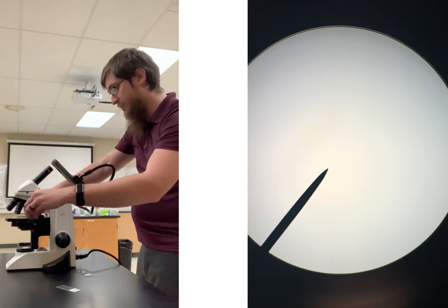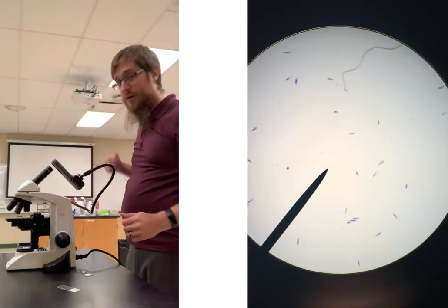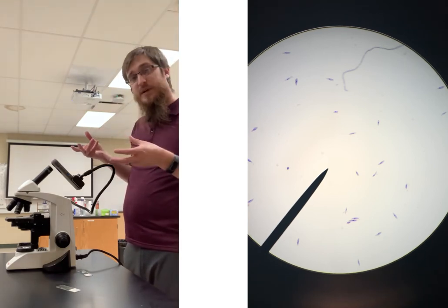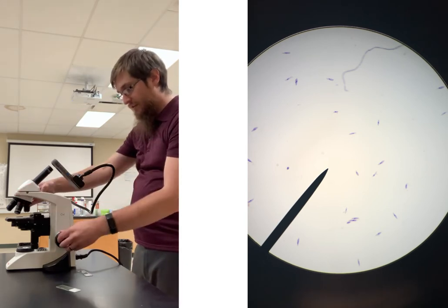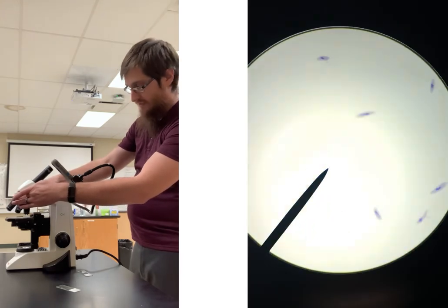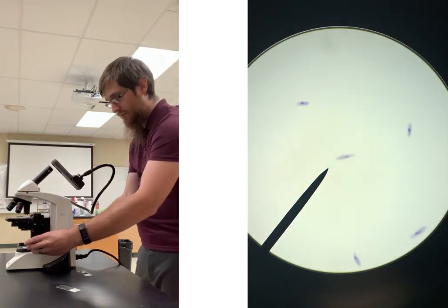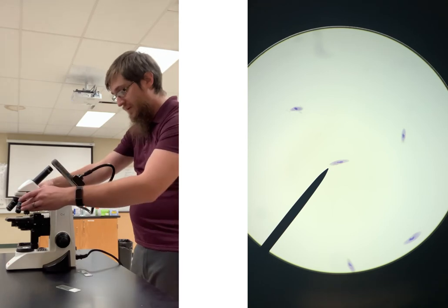In this case here, we're going to be looking at a paramecium, and our paramecium is going to be quite a bit smaller. So in this case here, again, those little purple specks are what we're looking at. And as I'm going through again, it looks pretty focused on our 4x here. I can then go ahead and move down to my 10x. We'll try to single out one of them and get it right by our little pointer here.